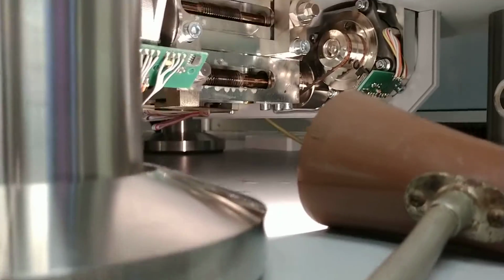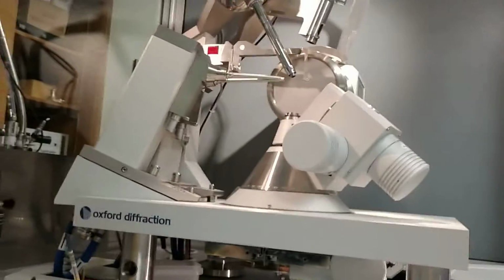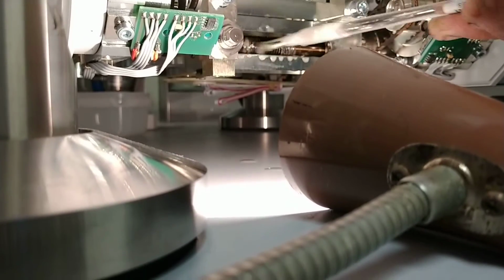So my first clue is that it was moving when Omega was moved. My first clue is that it was moving while we were turning Omega. My second clue is it looks nice and shiny when the light hits it, like there's oil on it now.